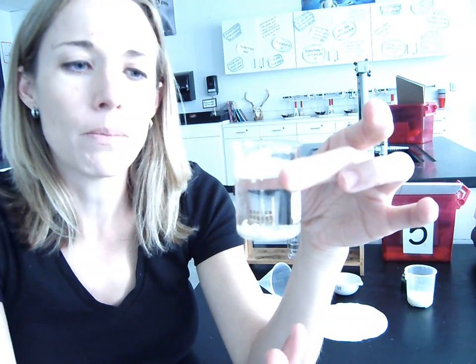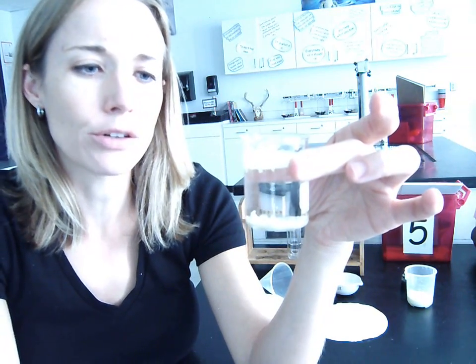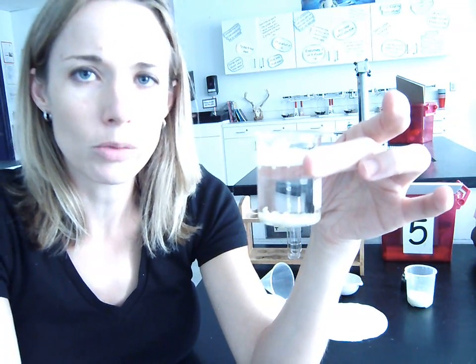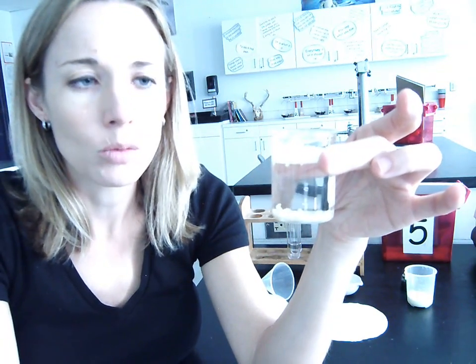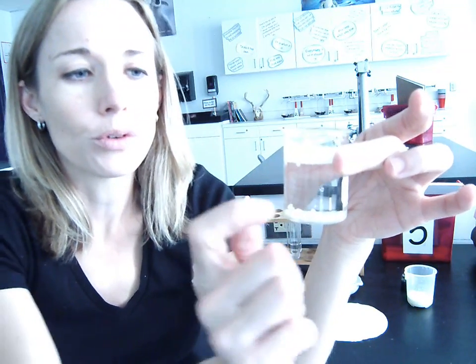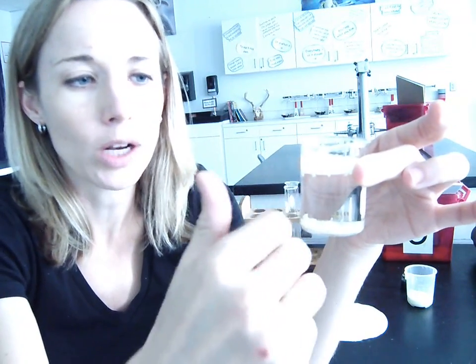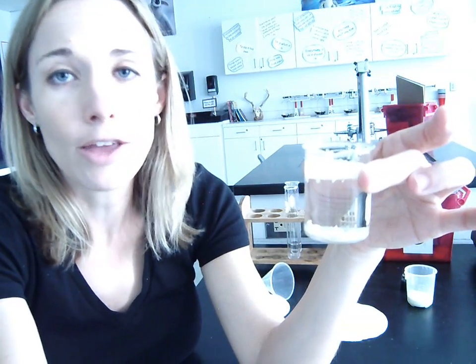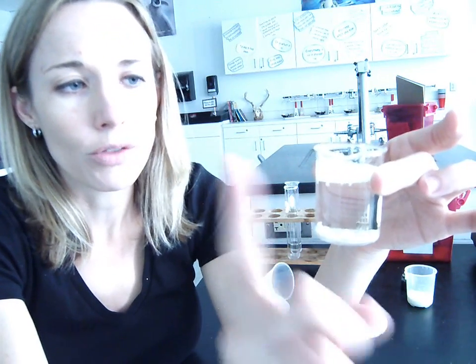So there are two things that have to be in place here. The two solids that are involved have to be insoluble in water, or whatever liquid you're using. This method works with other liquids as well besides water. We always use water because it's the easiest access. So the two solids involved have to be insoluble in whatever liquid you're using, meaning that neither one of them will dissolve. Because if one of them dissolves, this method doesn't work. So that's the first thing.